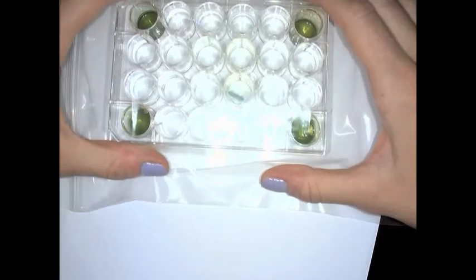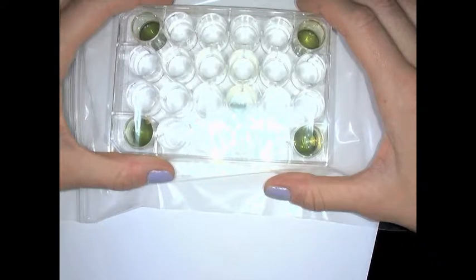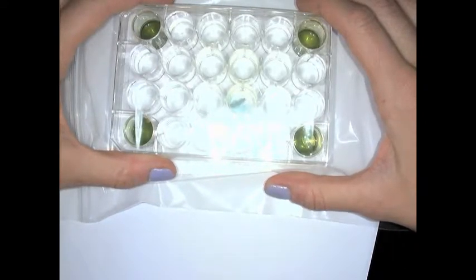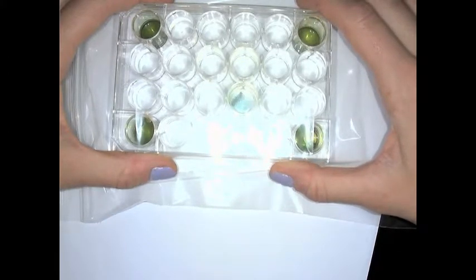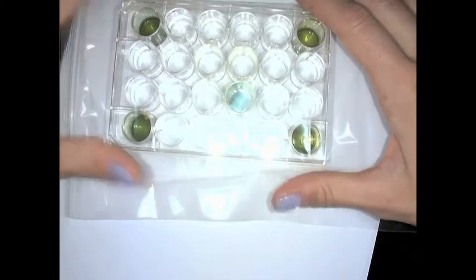There's a little bit of glare on the bag, but now you can see there's some bubbling going on, so you can see there's a reaction taking place. And for those of you watching, make a prediction of what color you think that copper is changing. And if you're saying to yourself blue, you are correct.